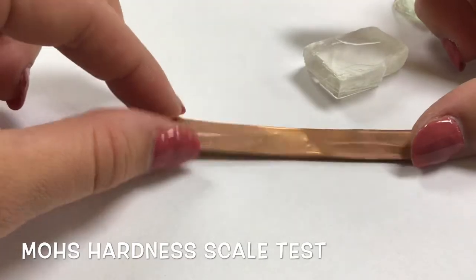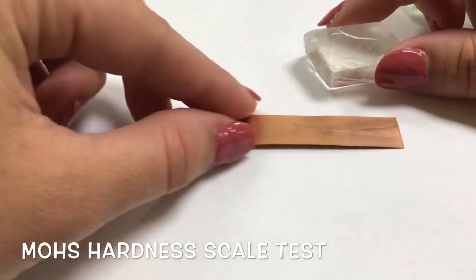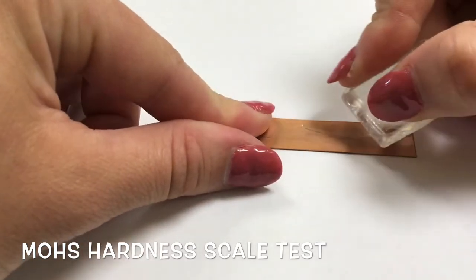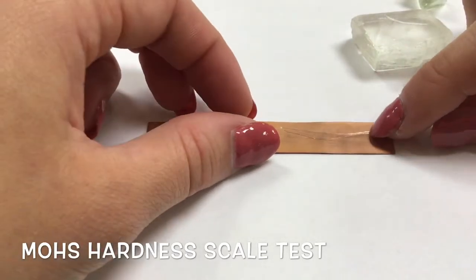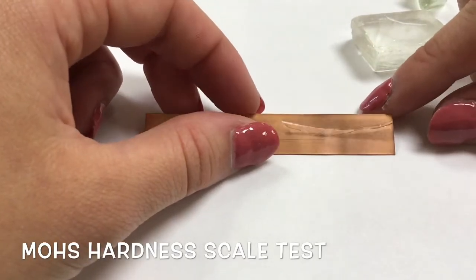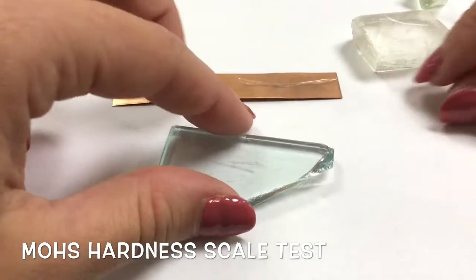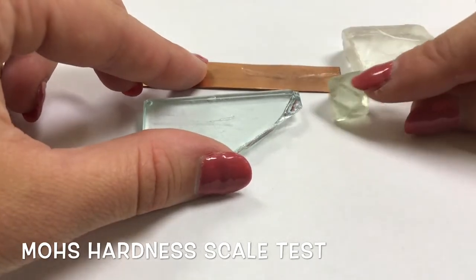So we already have some scratches on here. Okay, so let's check and see. We'll do this side. All right, will it leave a mark? Kinda did, but yeah, so it scratched the copper. That means it is harder than copper, but softer than glass and softer than quartz here.